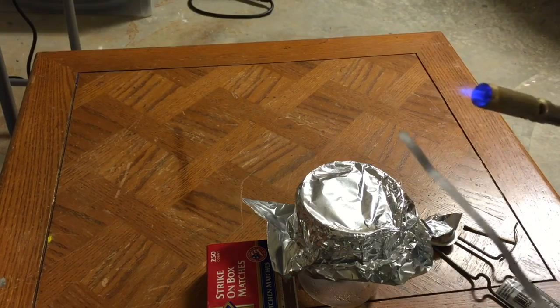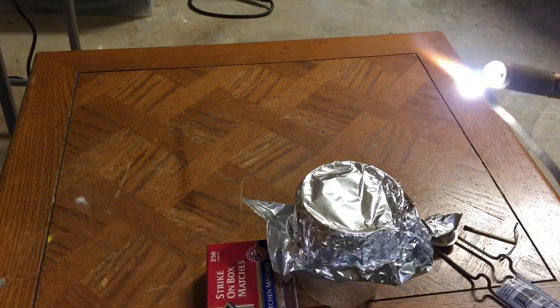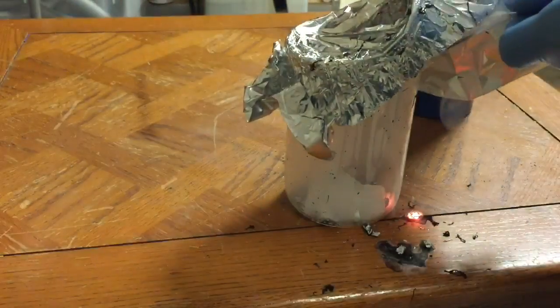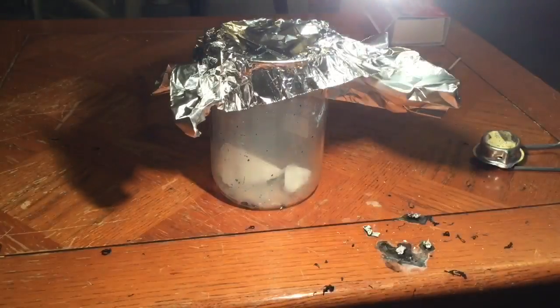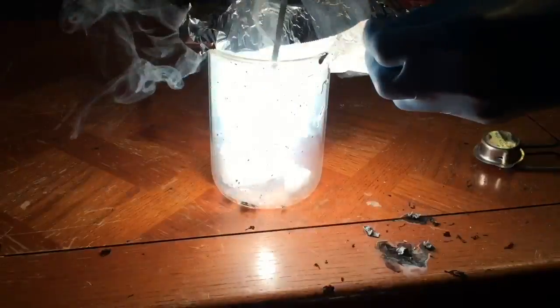Okay, here goes — we're going to light it. There it goes, and now we're going to put it in the CO2. It's much, much brighter and much more active in the CO2 atmosphere. Now let's stick it in the CO2 and watch what happens — much brighter, with explosive force and a lot of heat.